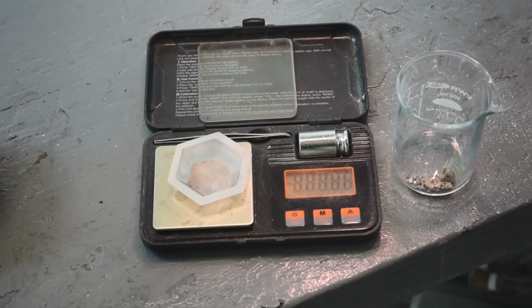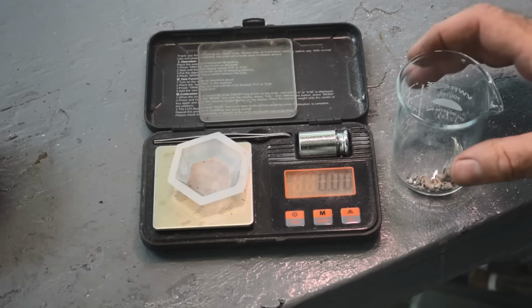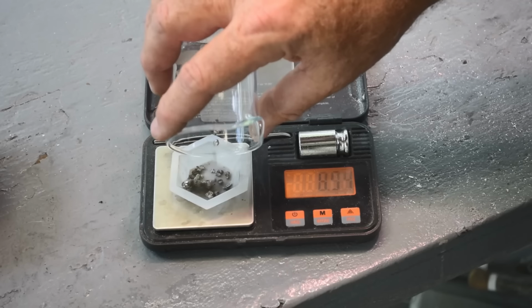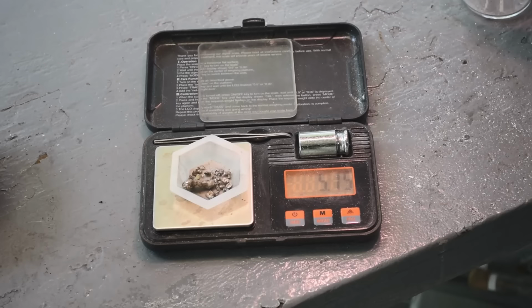See what we've managed to salvage from this fiasco today. I mean, I've had some bad days in the lab before, but this borders on the most catastrophic of all. So let's see what we've got here. Oh yeah, 5.15 grams of palladium. Not nearly as much as I was expecting to get. Just one thing after another.